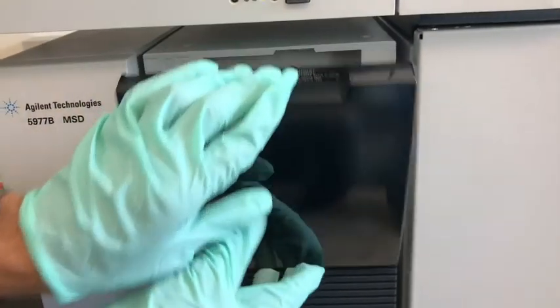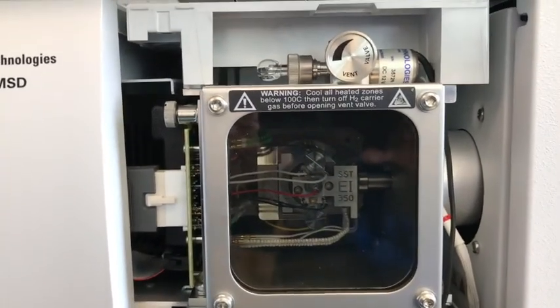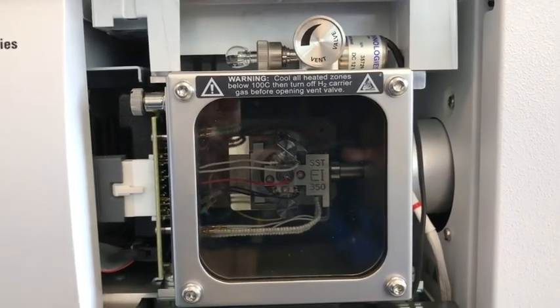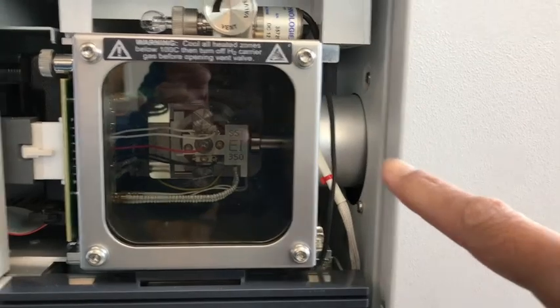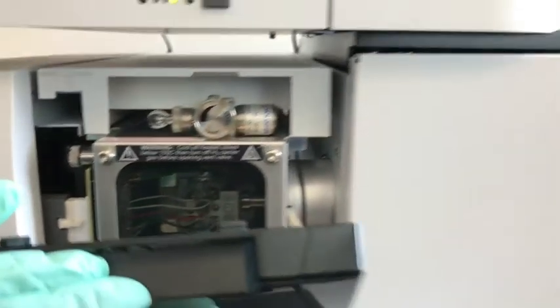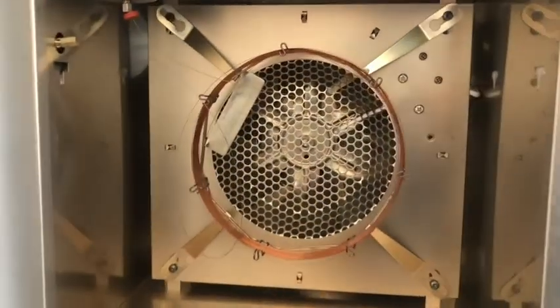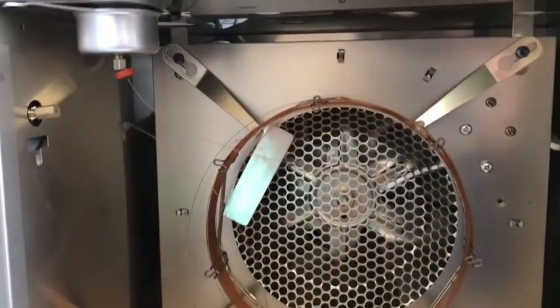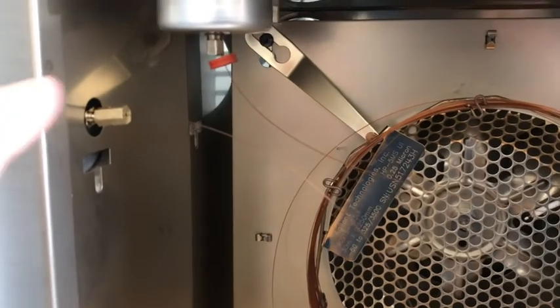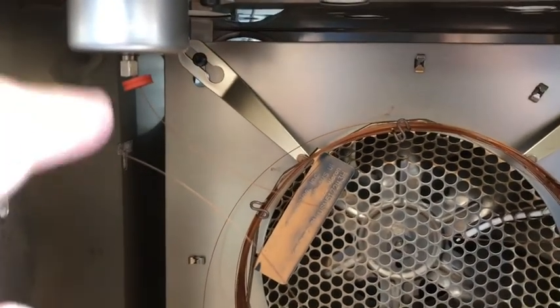The mass spectrometer is down here — that's the transfer from the GC column, which is on the right, to the mass spec on this side. The GC column is placed in an oven and it's a capillary column, around 30 meters long. One end of the column goes directly to the mass spec, and the other end is attached to the injector port.